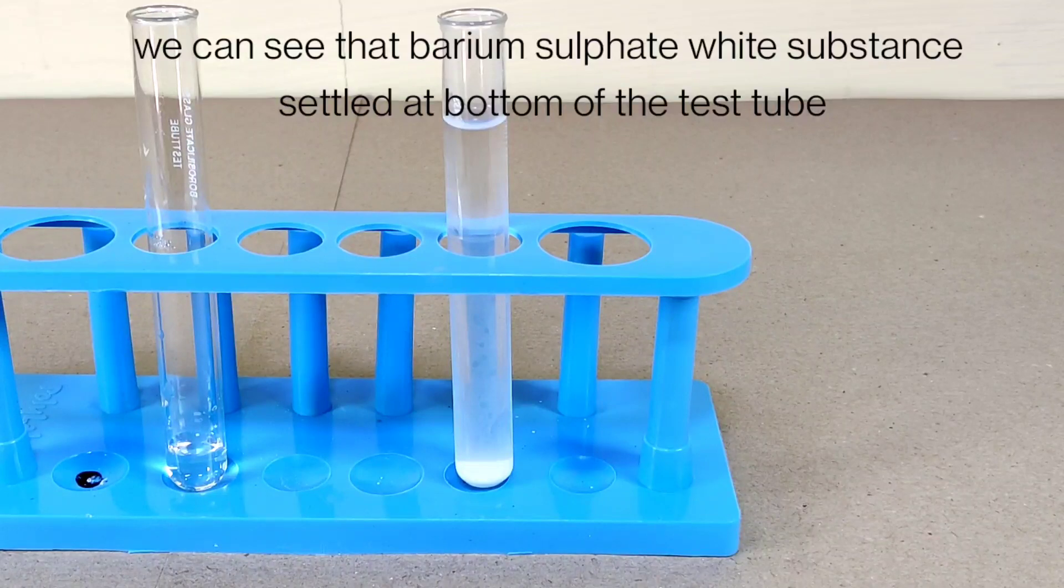We can see that barium sulfate, a white substance, settled at the bottom of the test tube.